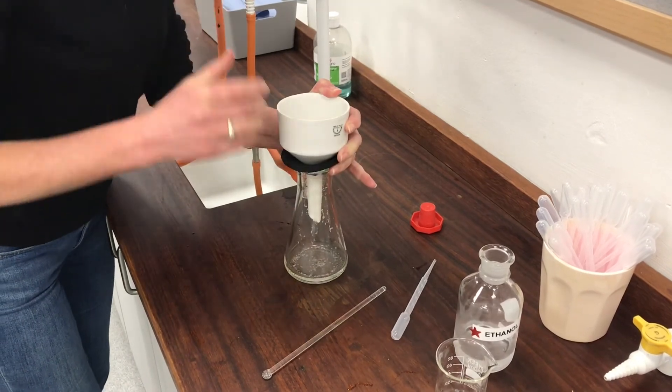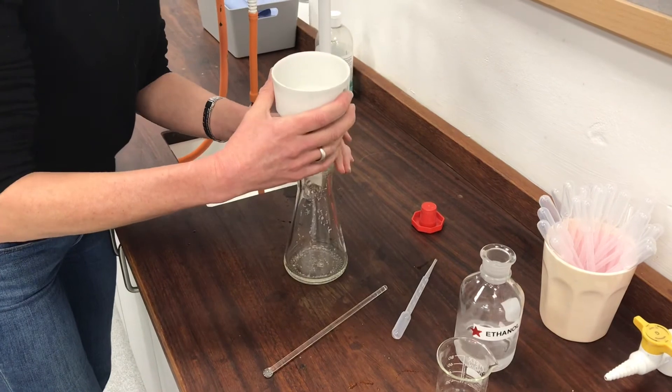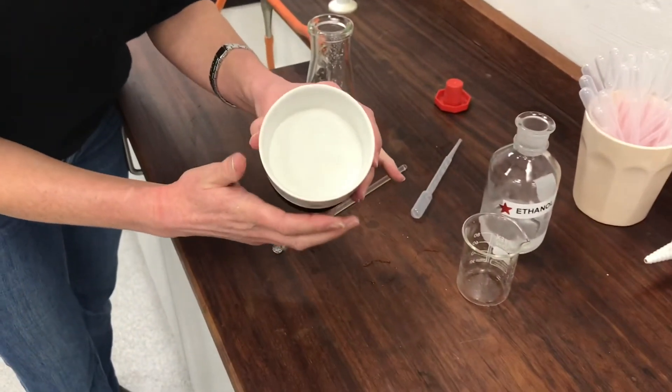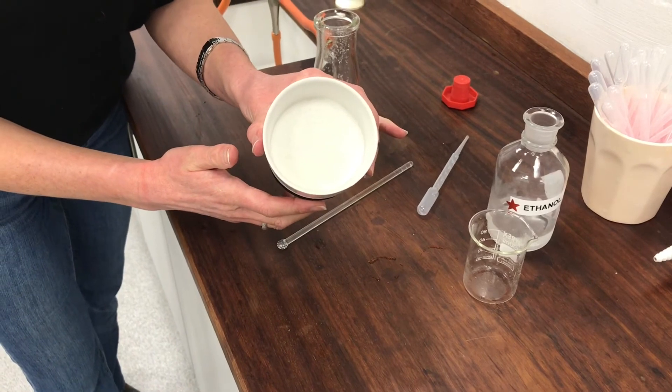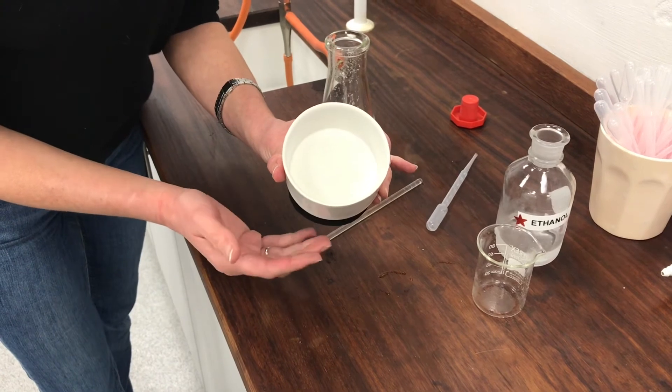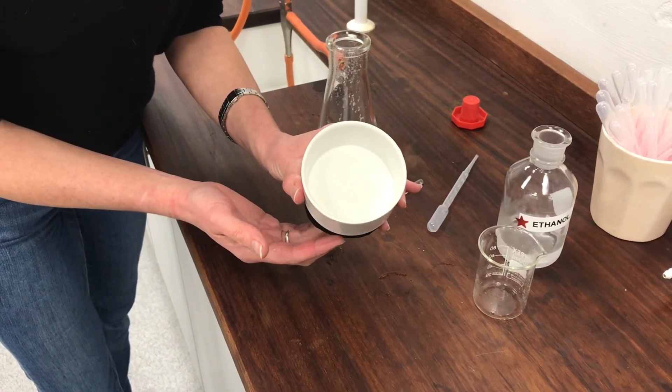For the moment, I think I've sucked quite a lot of the solvent out of that. If I show that to you now in the funnel, you might not be able to see it because it's very pale and it just looks like the paper. But what I'm going to do now is to try to lift that out and transfer it onto a watch glass so that I can leave it to air dry.